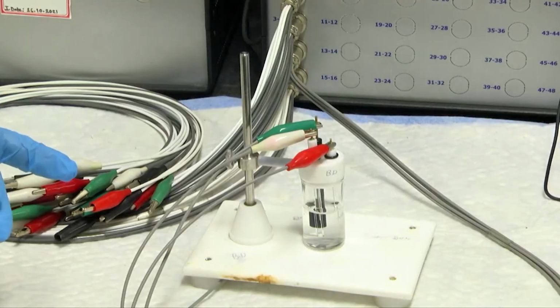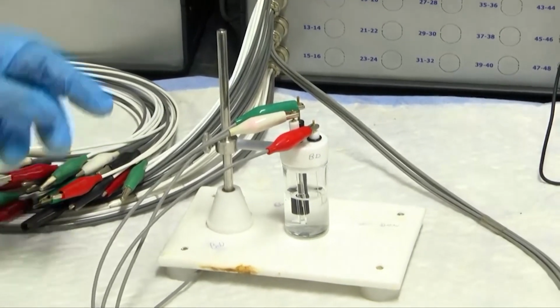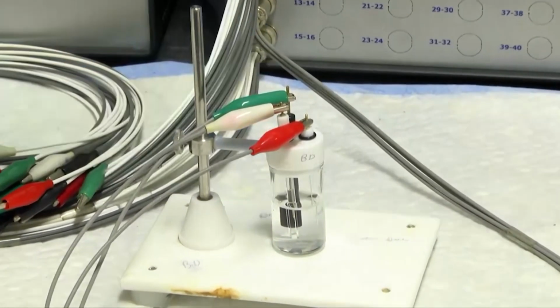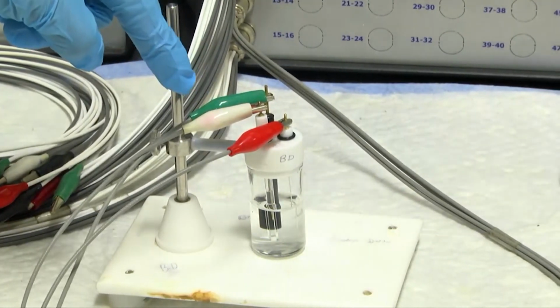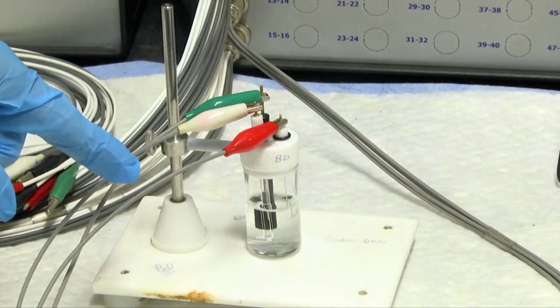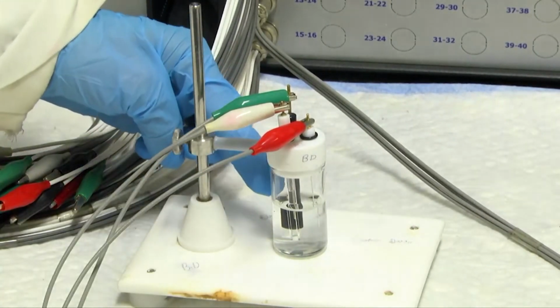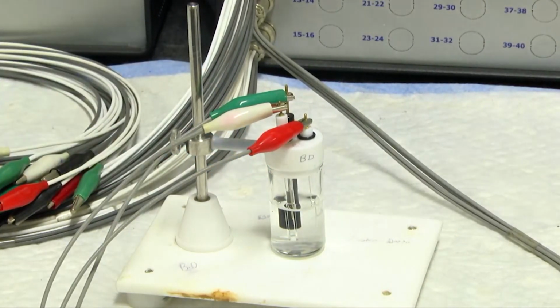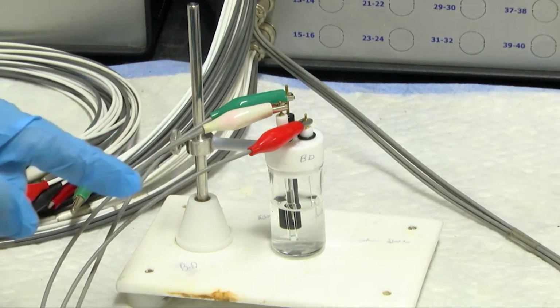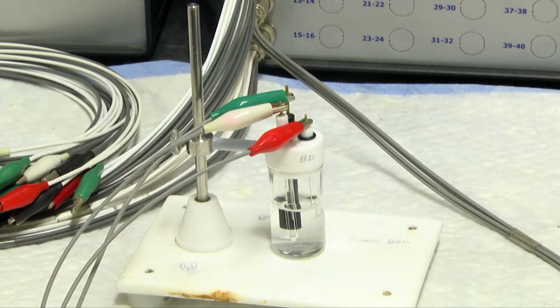This is the 3 electrode electrochemical system with the electrochemical stand. As you can see, you have a working electrode, reference electrode and the counter electrode within this arrangement, forming an equilateral triangle like arrangement. It should be ensured that the electrodes do not touch the walls of the container. So this solution consists of 1 molar H2SO4, and we will be performing the acid pretreatment for the working electrode in order to clean the surface.